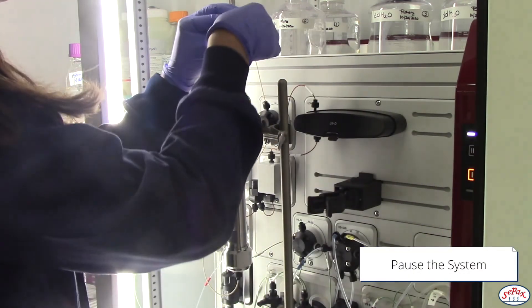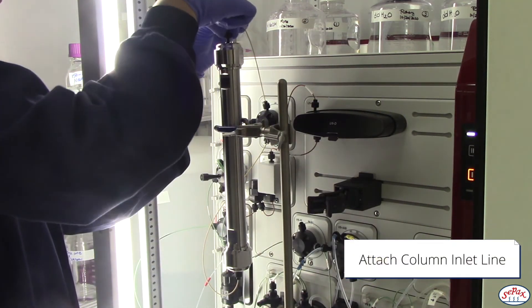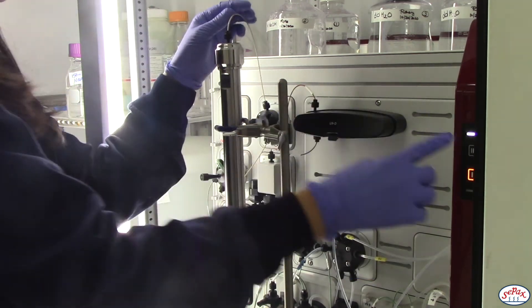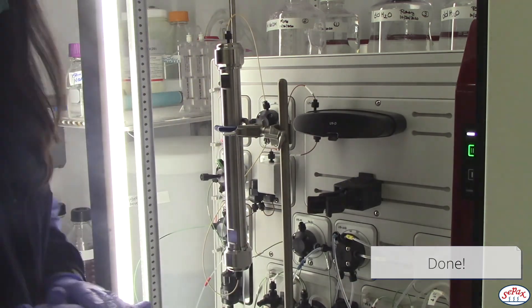Pause the system. Attach the column inlet line to the column. And you're done.